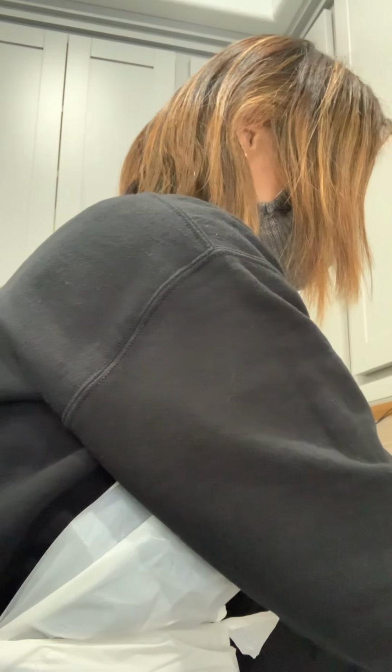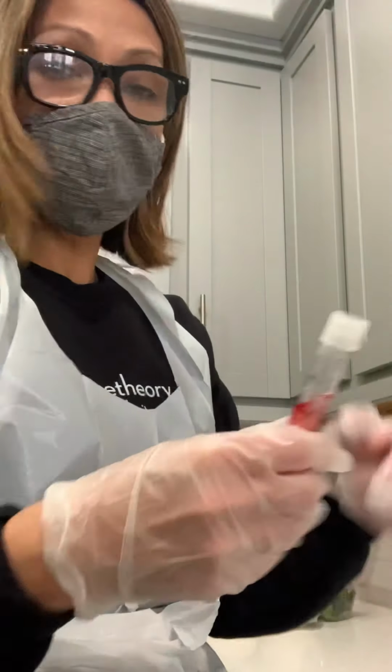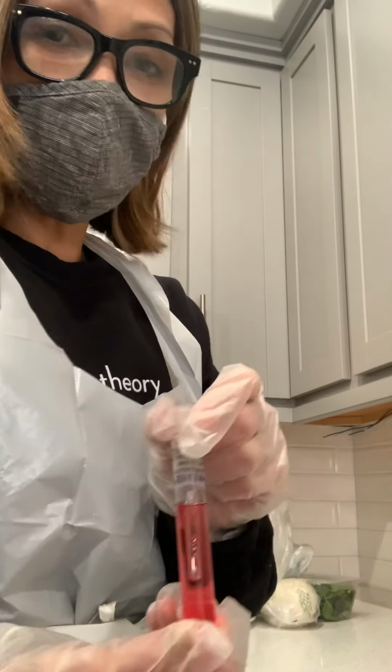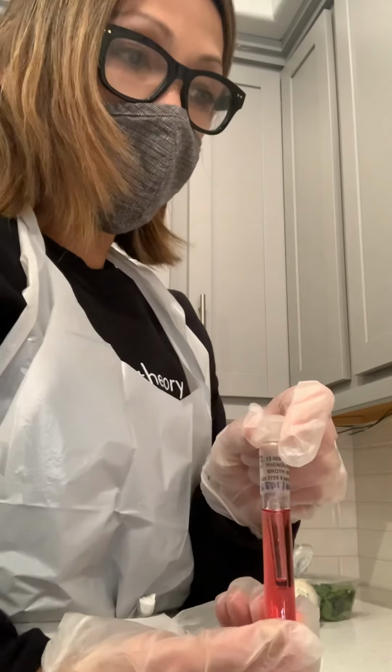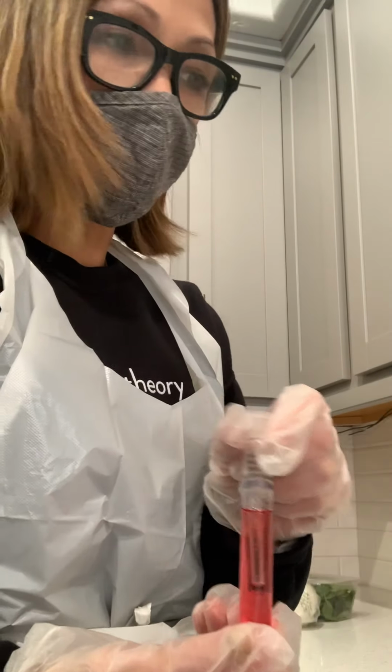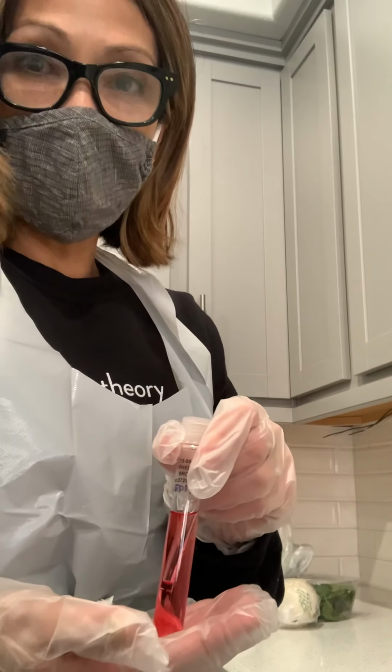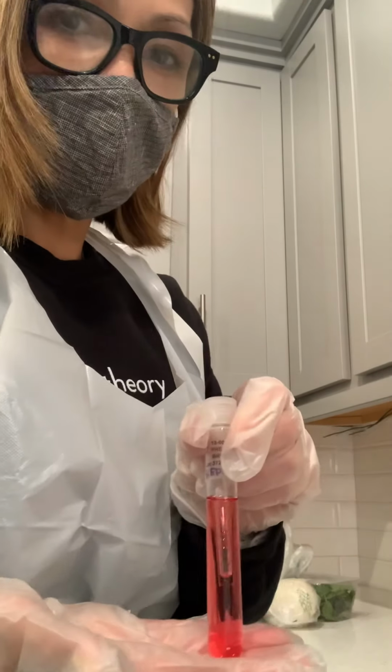Same as the other one, the mannitol is also negative for the epidermis. So there's an absence of fermentation in the organism, which means it's not using carbohydrates. That's why it's negative. Now we go to the yeast, cerevisiae.